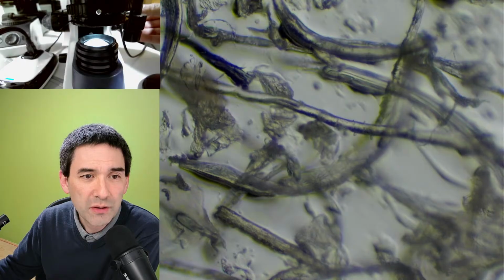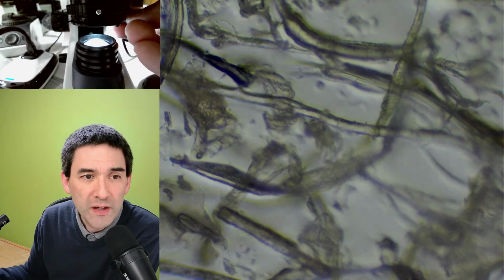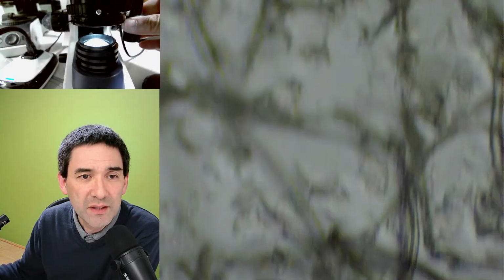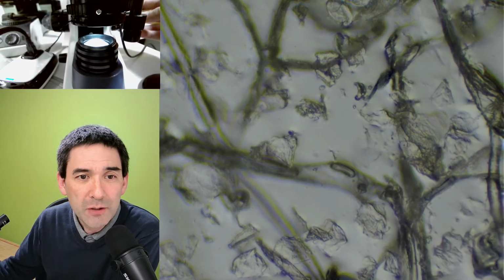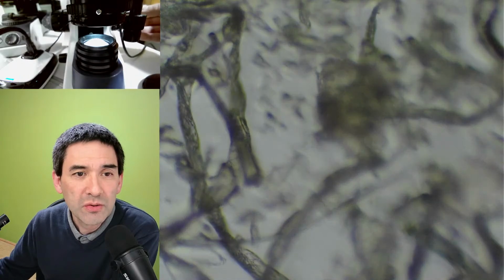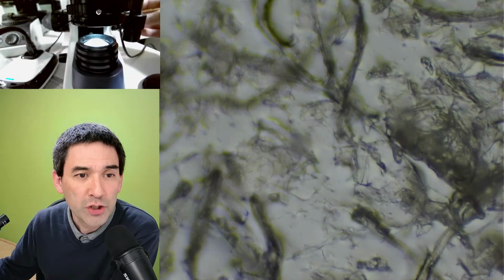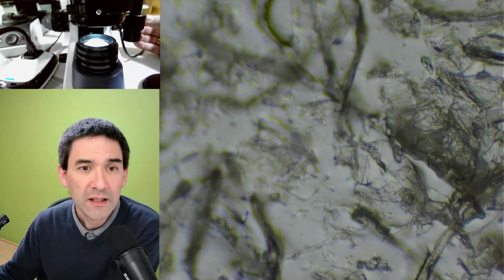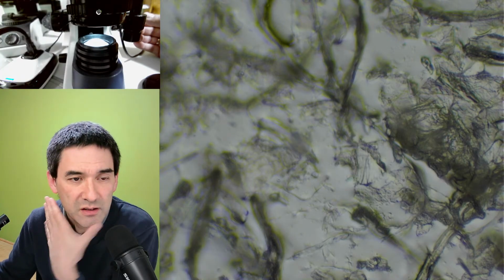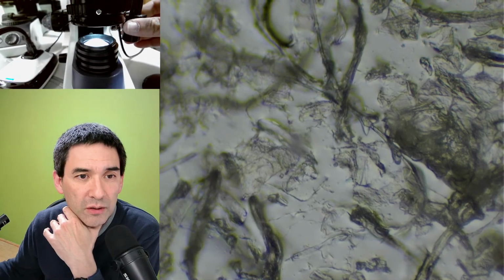Let me focus here a little bit. Light starts to come from one side, and this actually increases the contrast a little bit. And when you play around like this, you can get some very nice images. I'm going to show you a couple of other nice ones as well. I would like to simply encourage you in this video to experiment with it. I would like to share some of the filters that I tried and share with you my experiences. That's pretty much it, right? Ultimately, there's a lot of trial and error going on here.